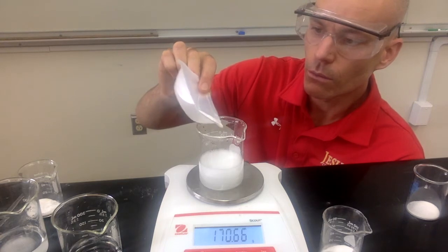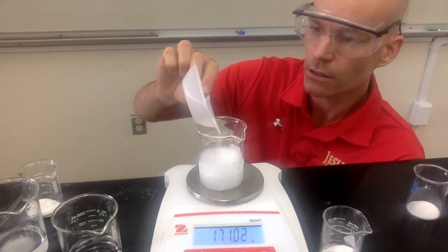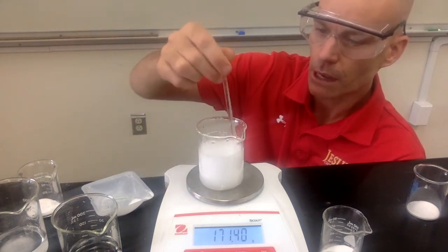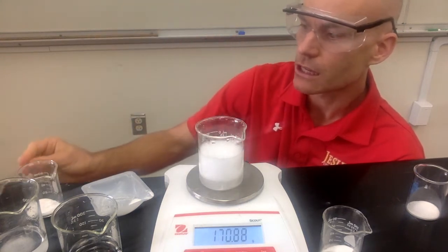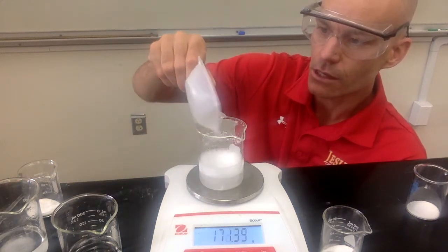And so this time, we've got to finish letting this react. It takes a little while. If we do it too fast, it'll overflow. We'll stir it to pop some of those bubbles and release the carbon dioxide. And as those bubbles are popping, as the carbon dioxide is being released, we're actually seeing that the mass is decreasing.